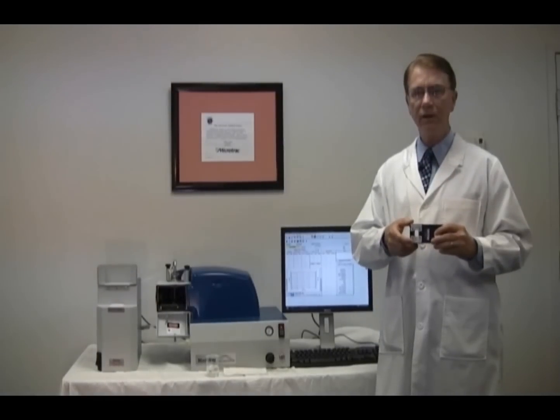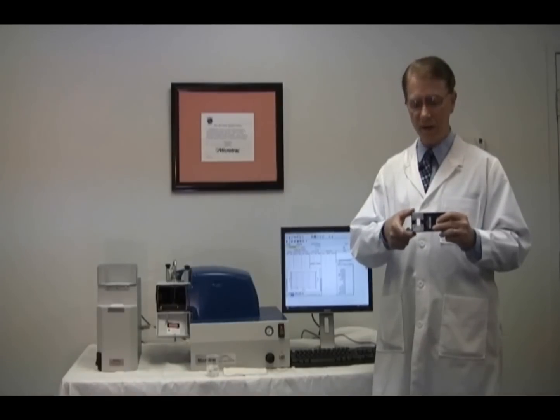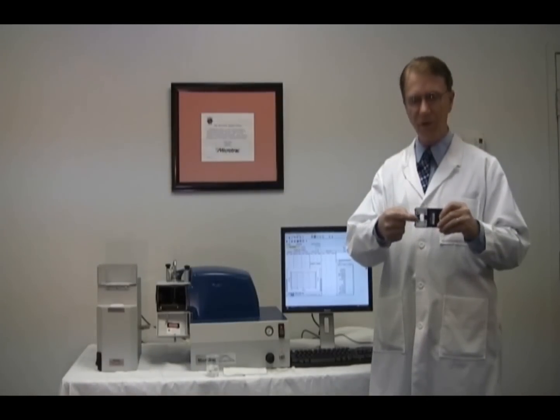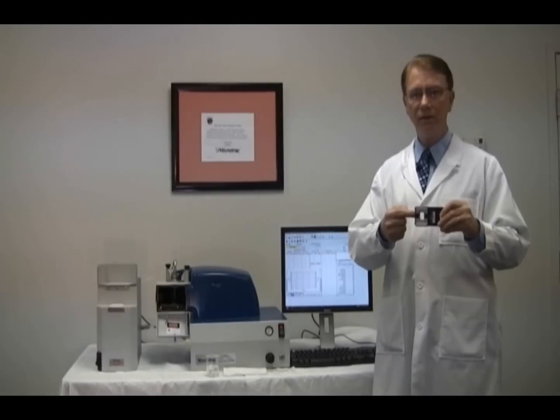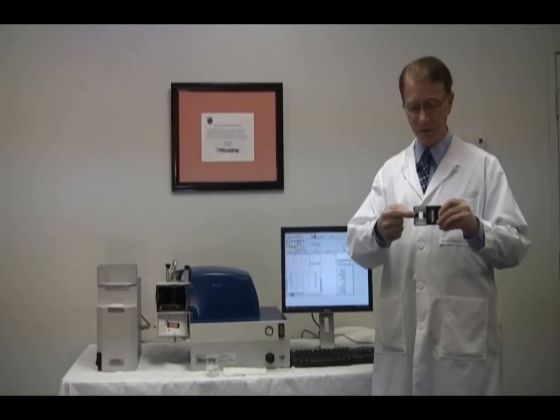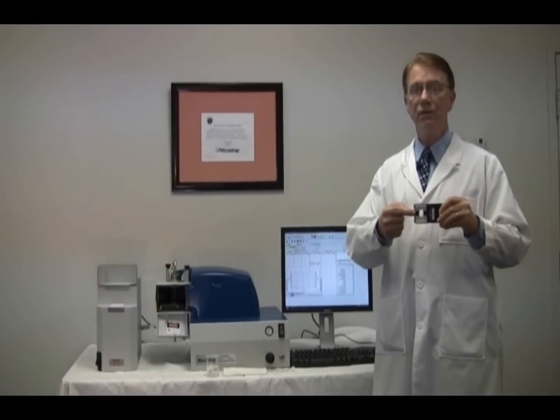In this segment, I will show you how to clean the sample cell. Please use care when handling the sample cell because the windows on the outside have a coating. This coating is similar to that used in some expensive camera lenses. Fingerprints and oils from your hands or fingers will cause extra cleaning.